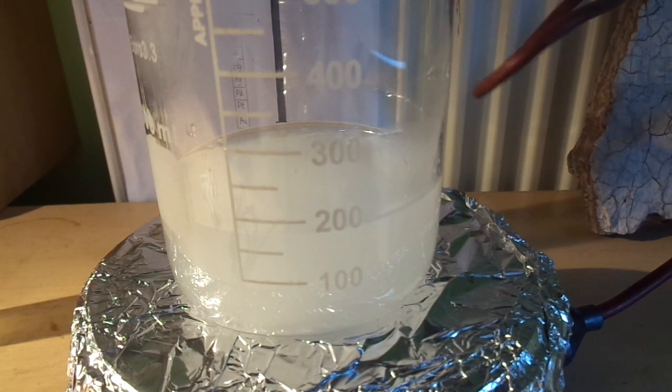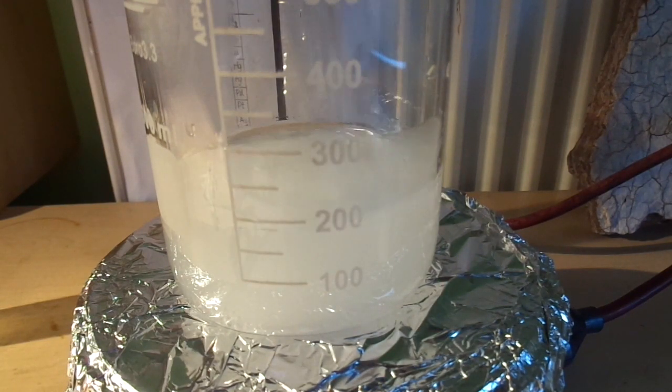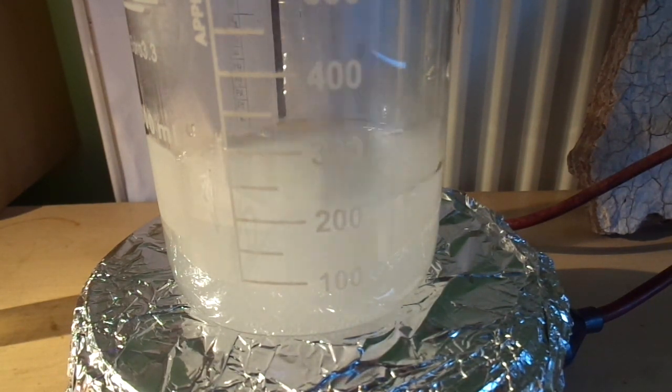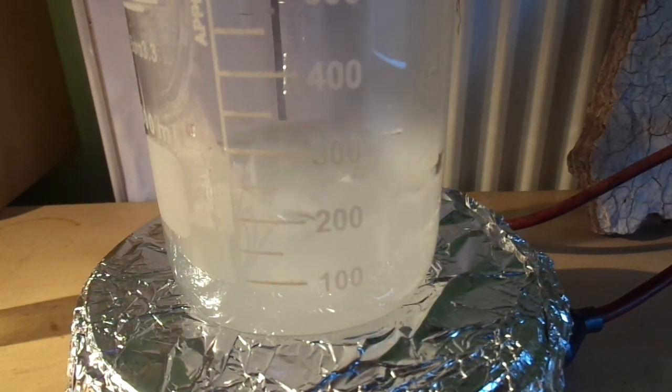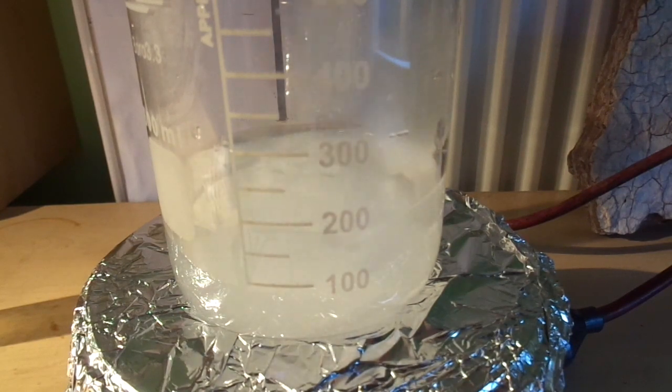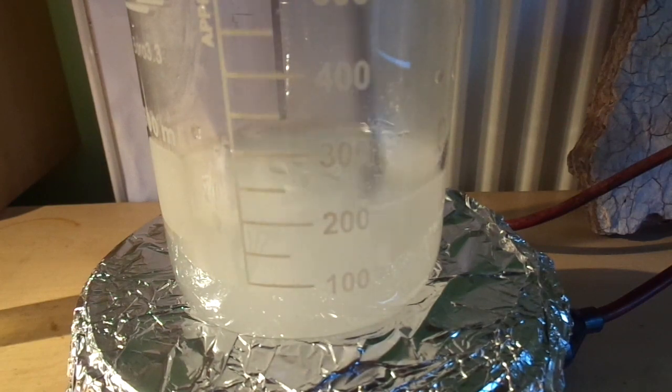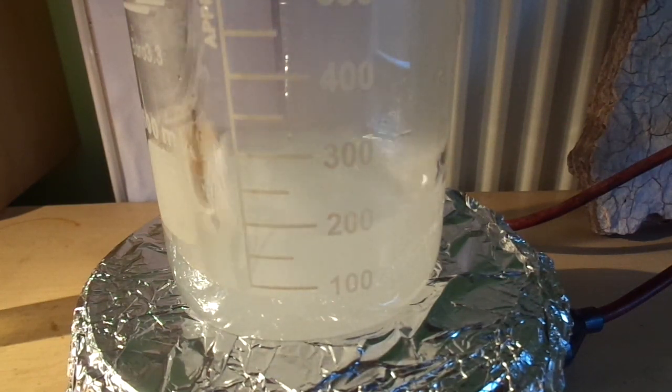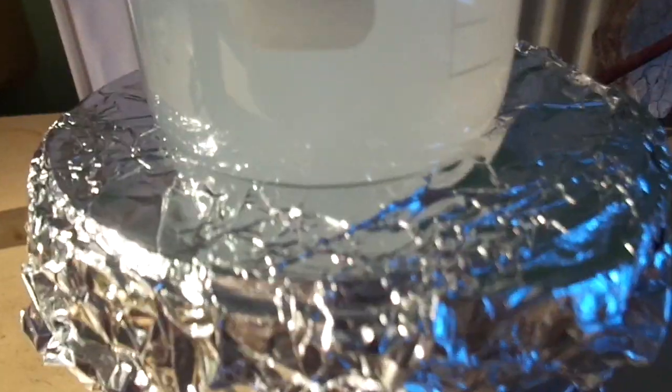Okay, it's starting to boil, so I'm going to turn it down because it has a little bit too much heat. As you can see, the borax is all dissolved. It's quite a cloudy solution.